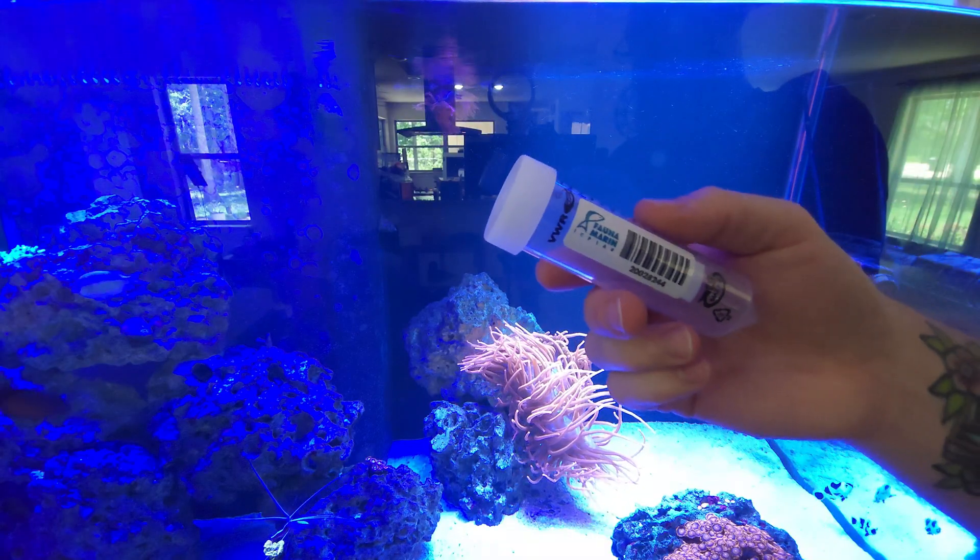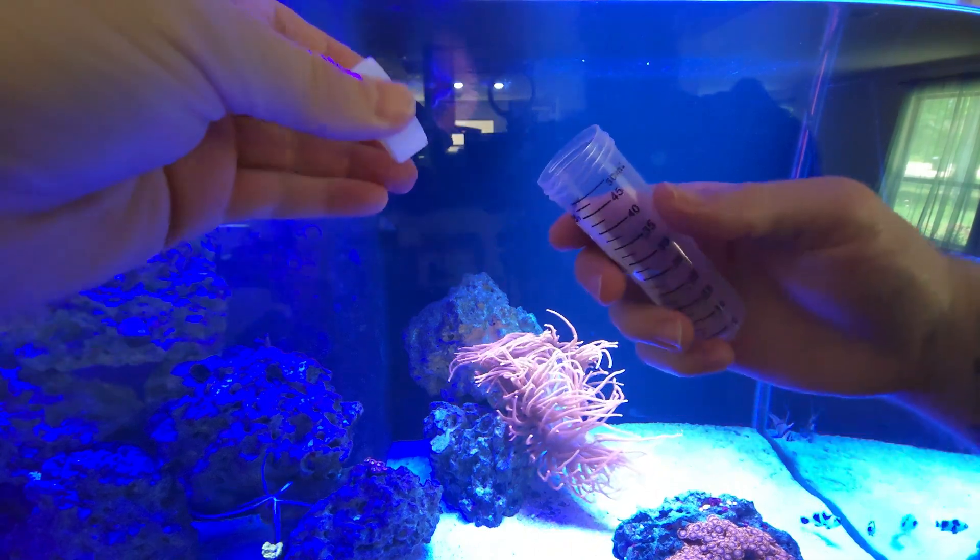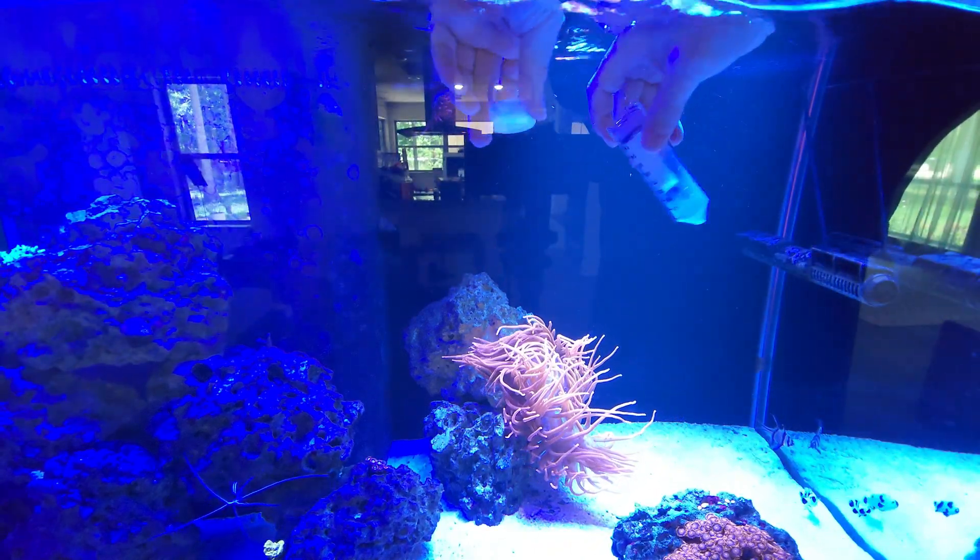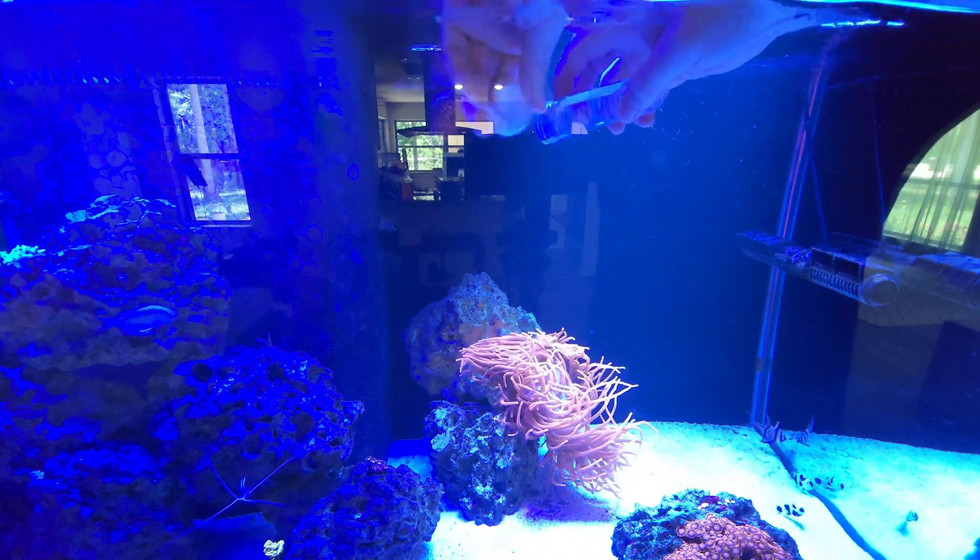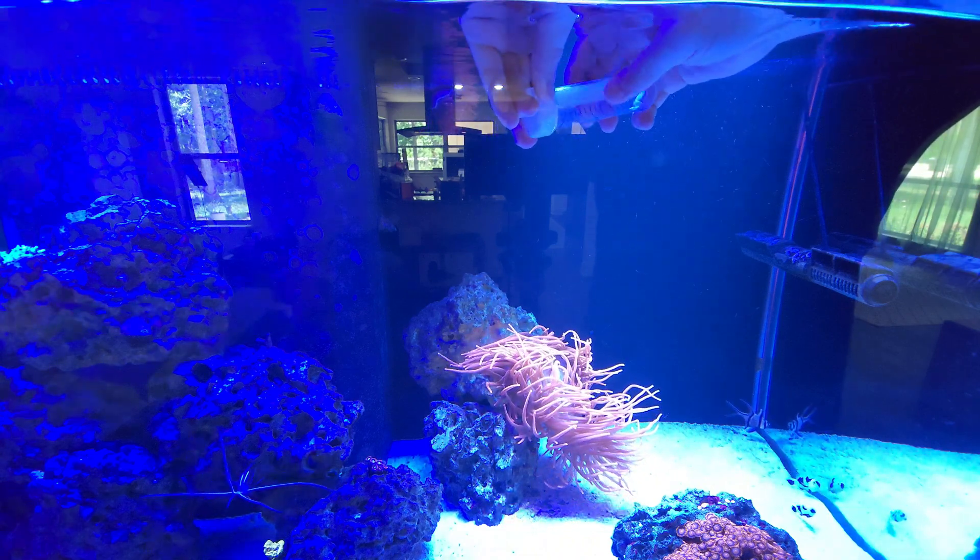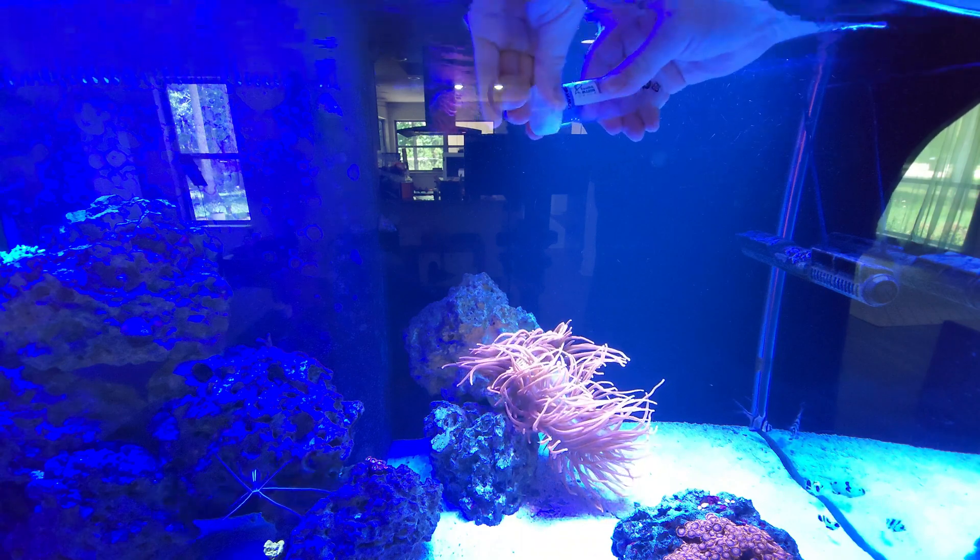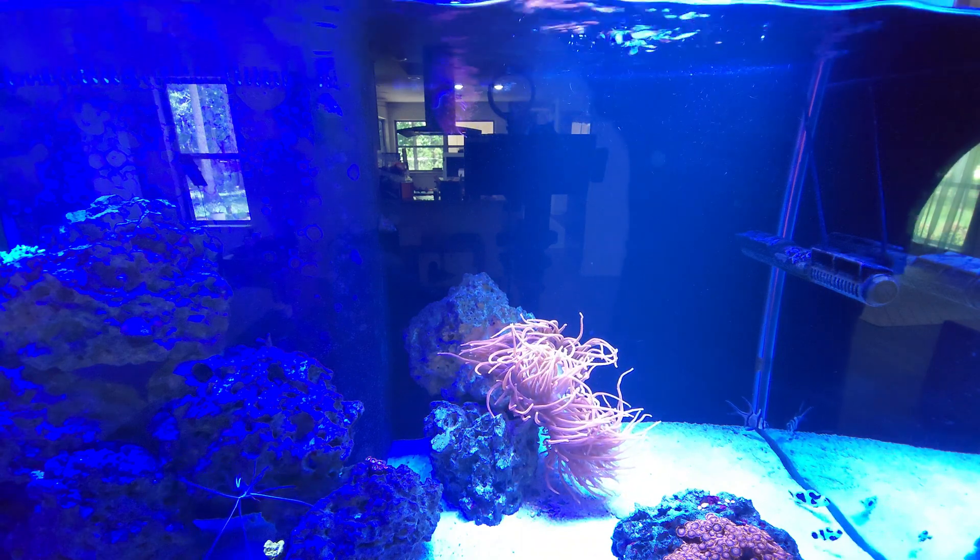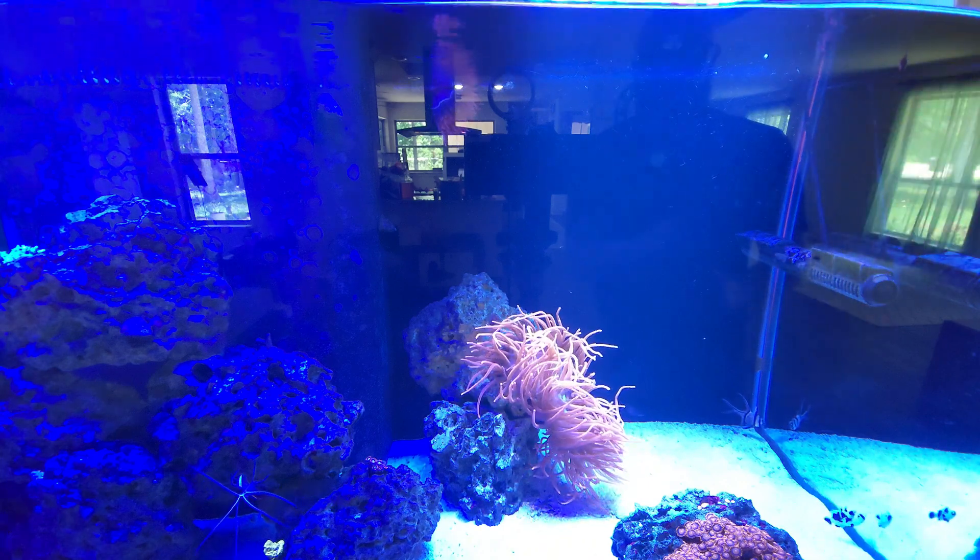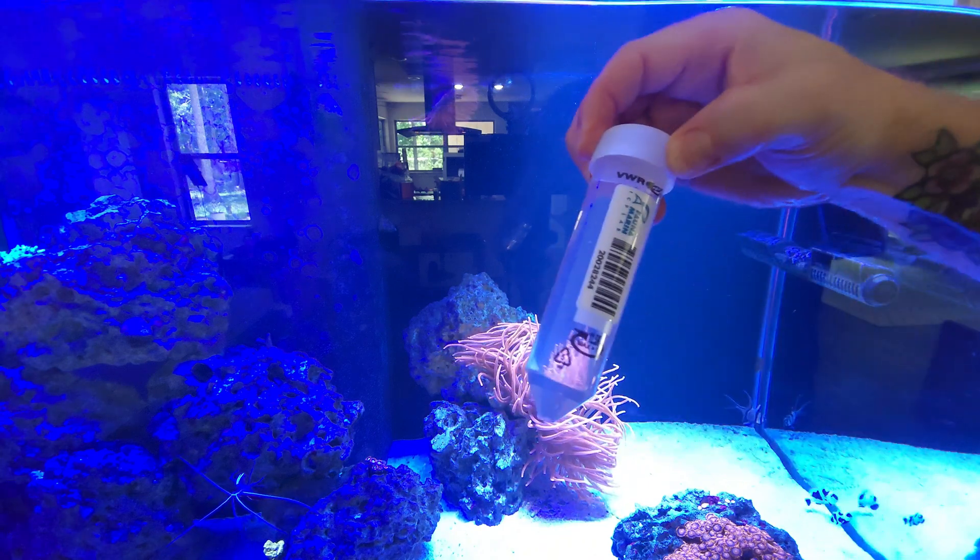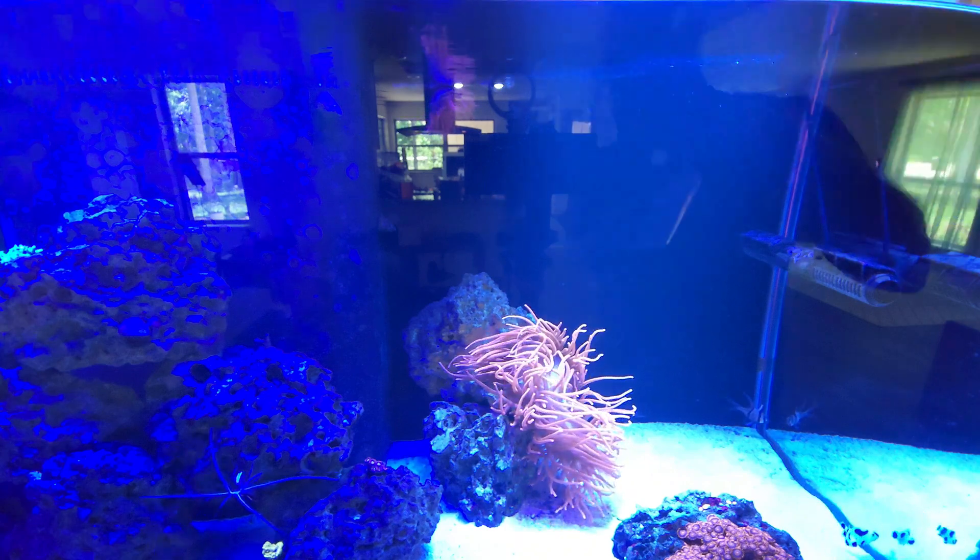Here's what you're going to do with the big tube. Take the top off, put both down in the aquarium water, shake all the bubbles out, and you'll want to close this up inside the aquarium. You don't want to get outside air or anything like that in there. Take it out of the water, rinse it off, wipe it off, and that's your big tube sample ready to go.